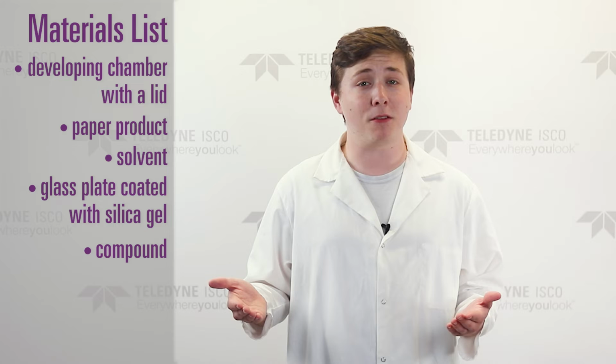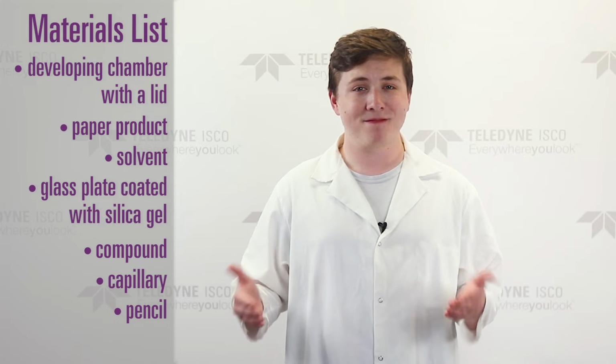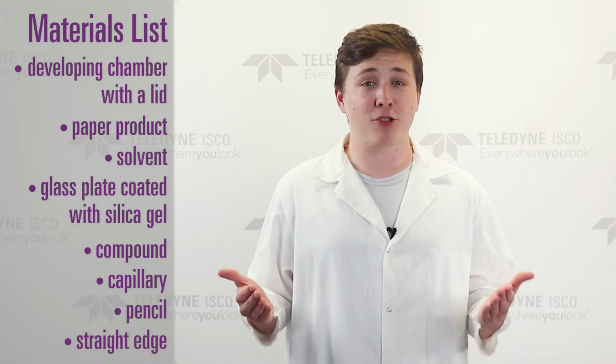Next, you will need the compound to be used in conducting the TLC. We will be using a simple dye for this instruction. To prepare your stationary phase, you will need a capillary to place your compound. You will also need a pencil and a straight edge to mark the stationary phase. In all, you will need the developing chamber with a lid, a paper product such as a paper towel or filter paper, a solvent, a glass plate coated with silica gel, a compound, a capillary, a pencil, and a straight edge. Let's begin the demonstration.